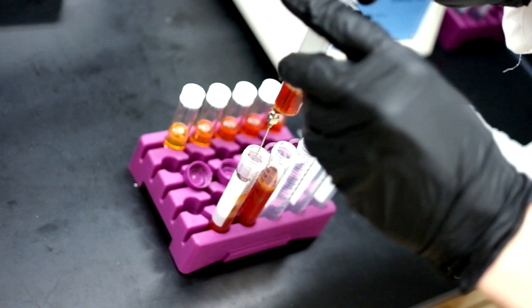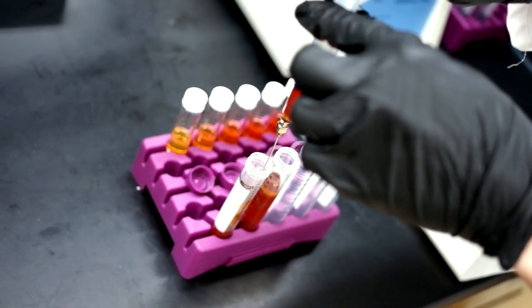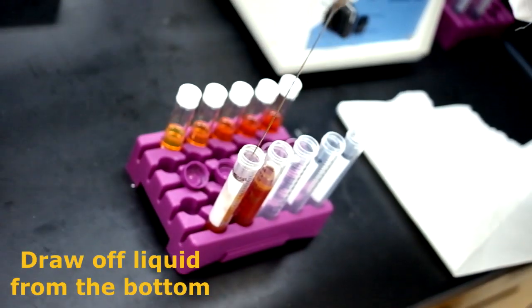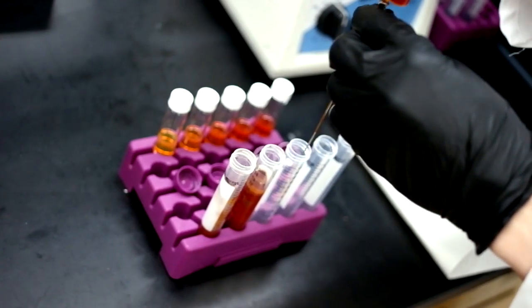A solid will form on the top and a liquid will remain on the bottom. Draw off the liquid from the bottom and redistribute it into three different test tubes.